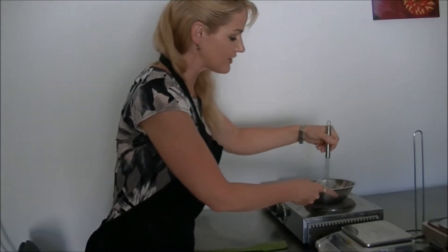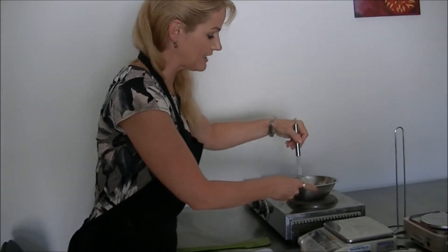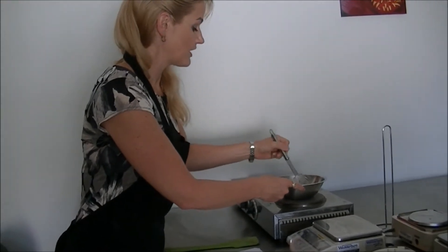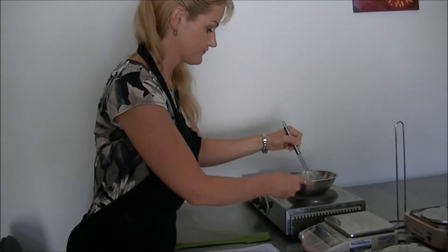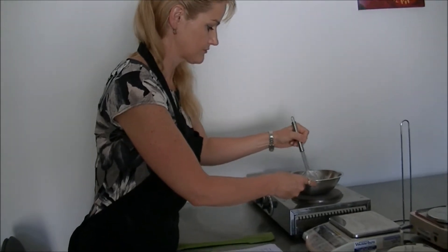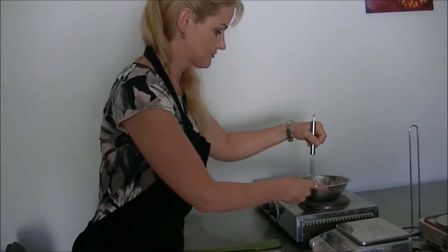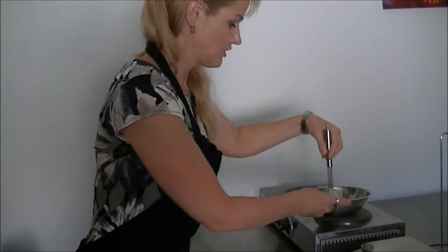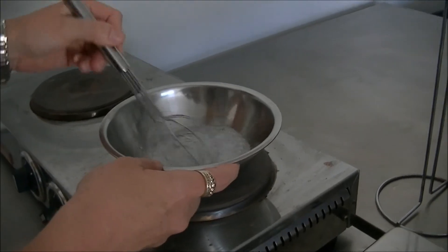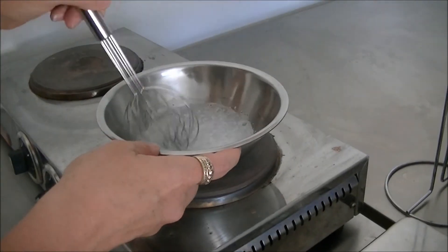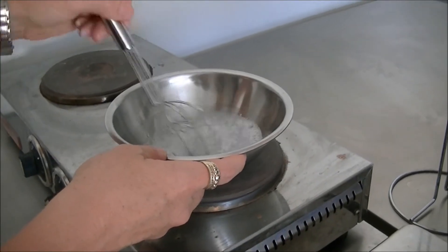You will invariably introduce a fair bit of air in lab sized samples. Remember the purpose of using surfactants is to get foam and bubbles. So that's why you need to be particularly careful with these materials - they will foam up significantly.